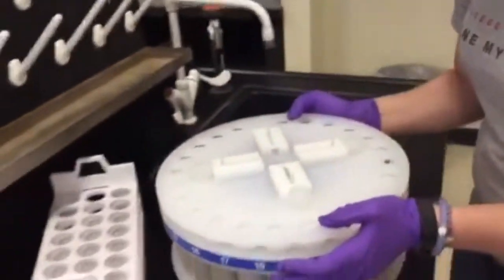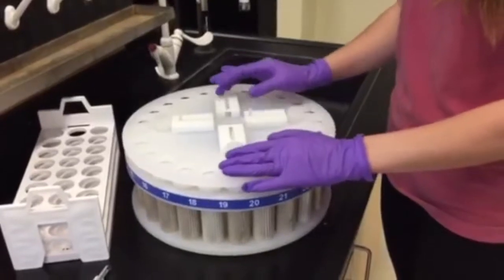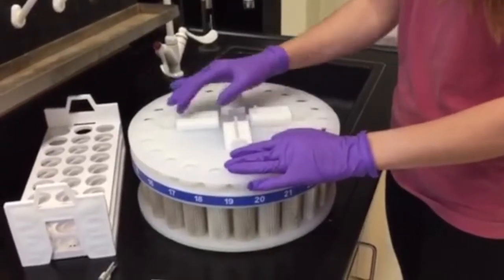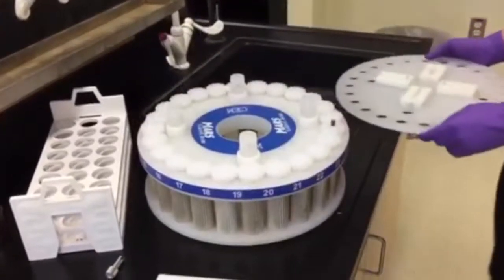Carefully remove the turntable from the microwave. On the turntable shield, you will find four pins. You must slide them towards the center of the shield, which will let you remove the shield.